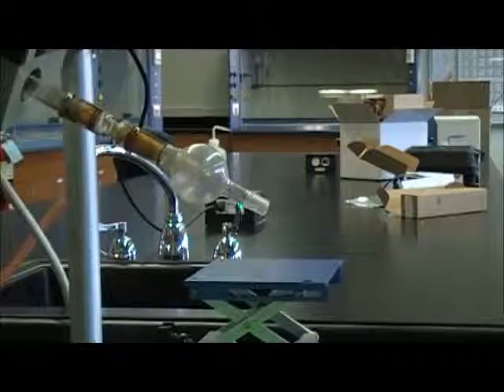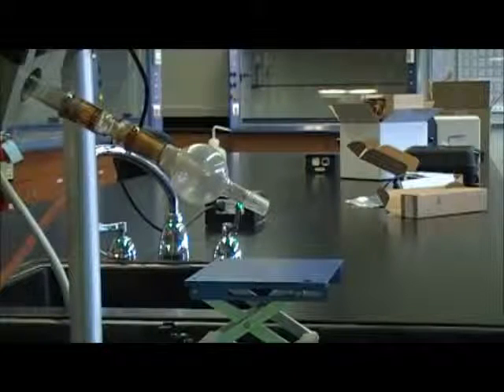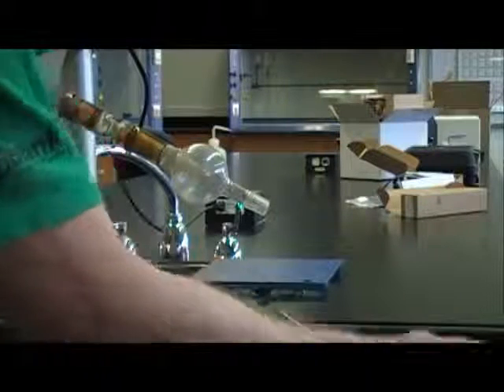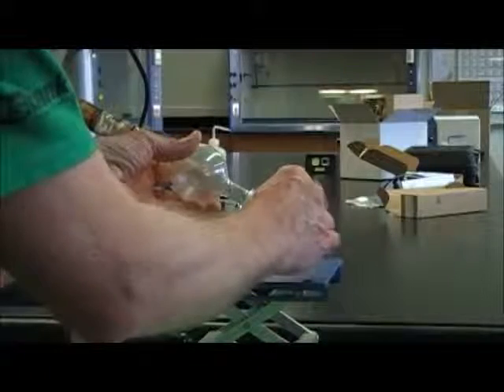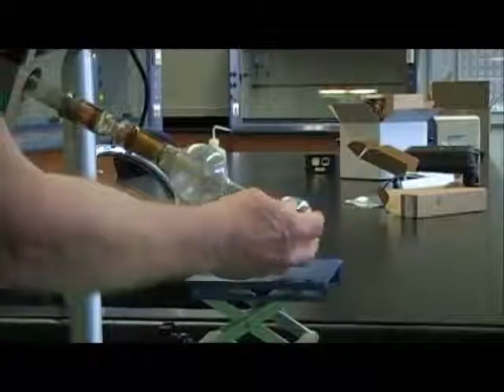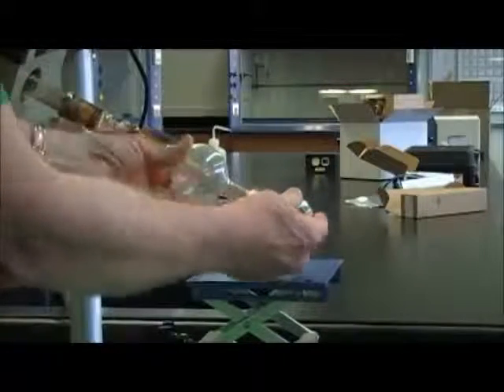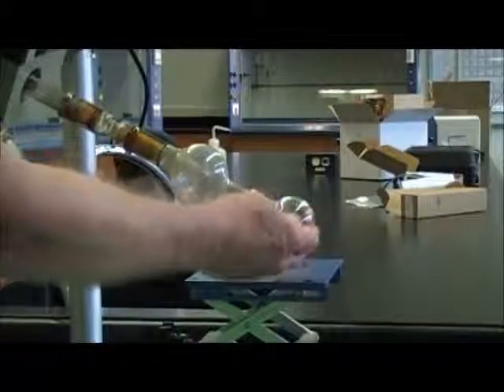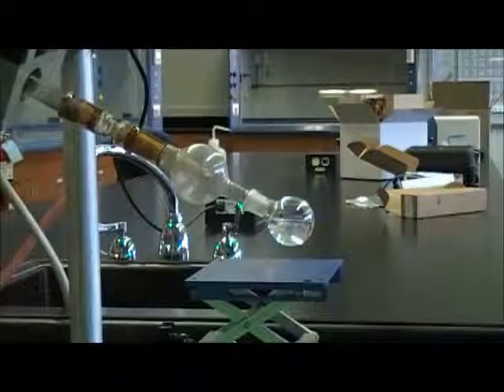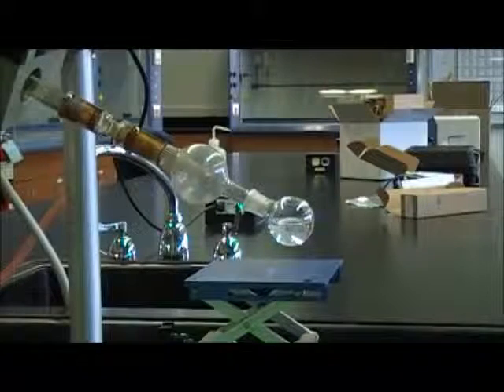So now what I'm going to do is attach the round-bottom flask with my sample in it and solvent. And I'm going to keep my hand on there for a few seconds until the vacuum is established. You can kind of hear the water of the aspirator changes its sound.